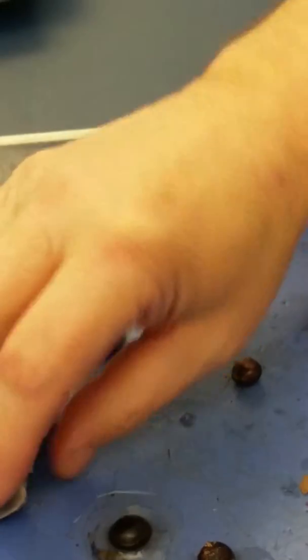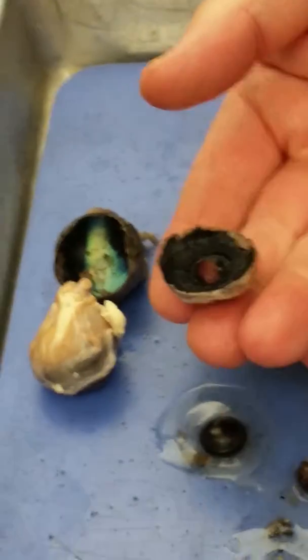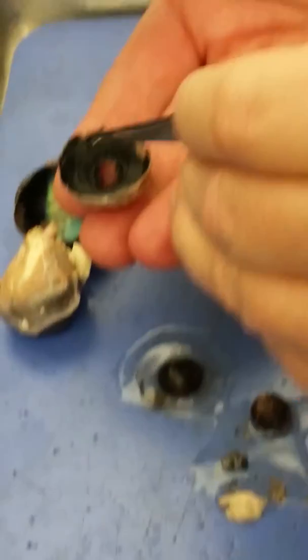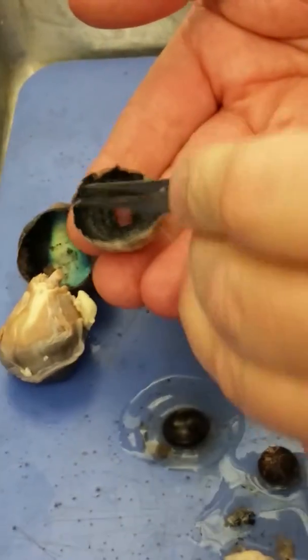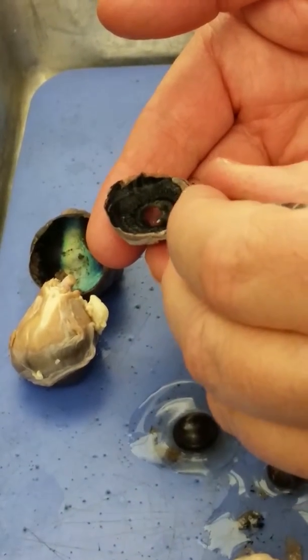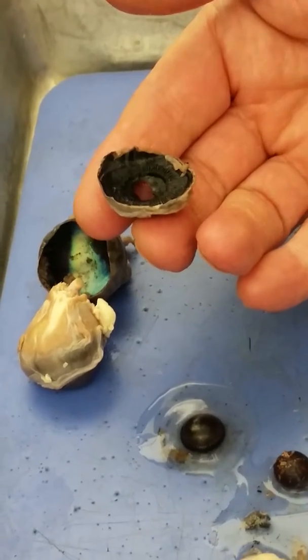Okay. If we go inside, we'll do the anterior part first. You can see the opening here. This is the pupil. It lies just behind the cornea. A ring of tissue around the pupil is the iris, which has a muscle inside that can change the diameter of the pupil. So under bright light, it reduces, and under low light, it opens.